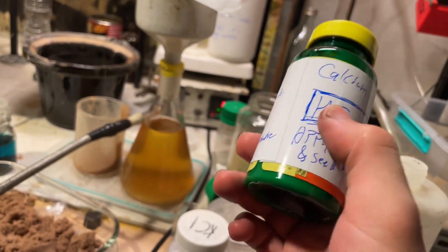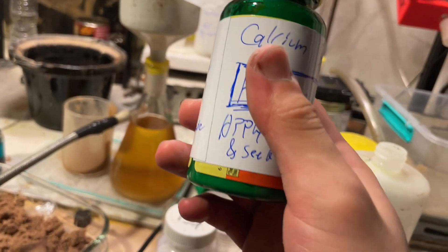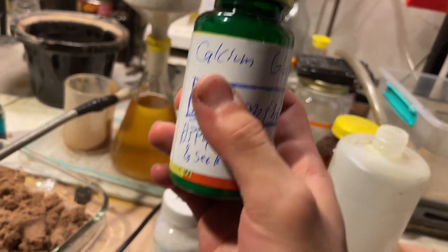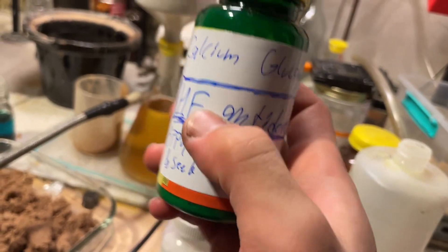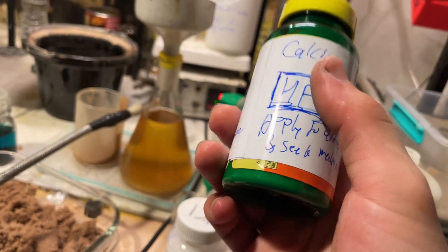I did have it on hand when I made HF the first time, but it was just in a beaker, so it's not really a proper thing. But yeah, here you go. You can buy the stuff, of course you can buy the proper stuff, it's called Calgonate.